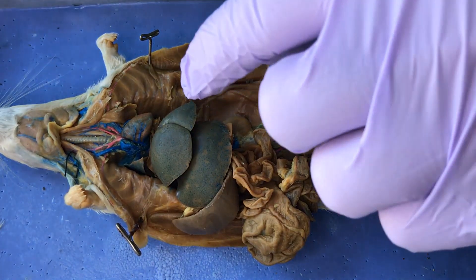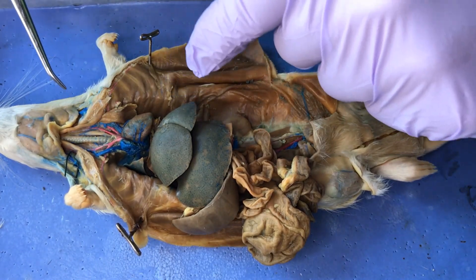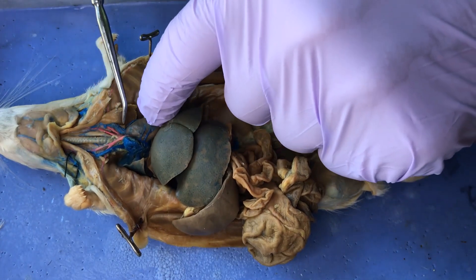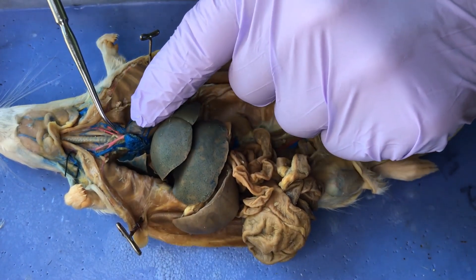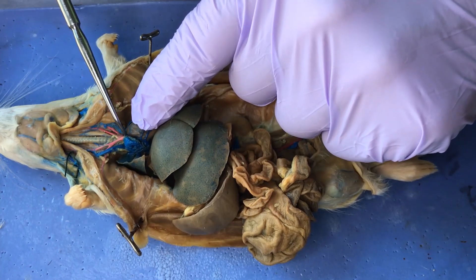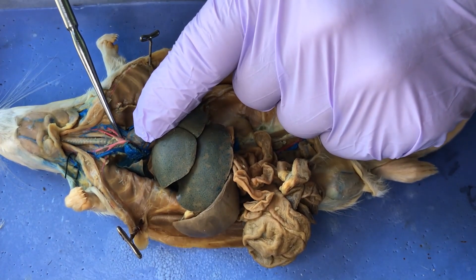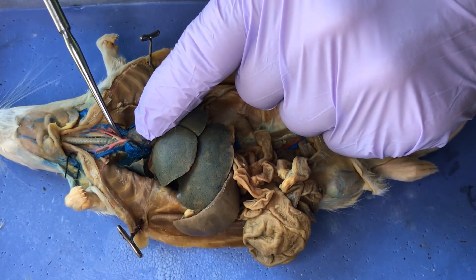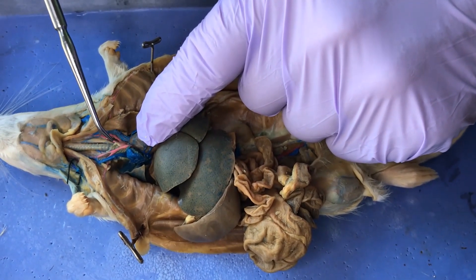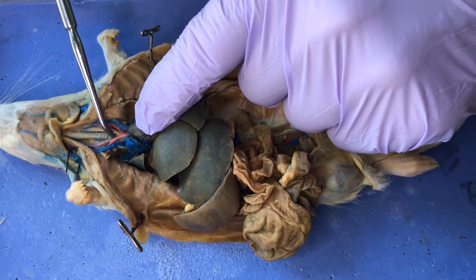This is the dissection of the blood vessels of the rat. We'll start here at the heart. You can see a big red blood vessel coming out right here — that's the aorta. The aorta forms this arch shape that goes over the top right there, so that's called the aortic arch. The first blood vessel that exits the aorta is called the brachiocephalic trunk.